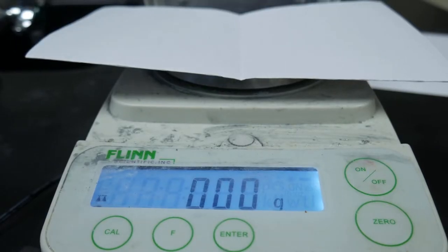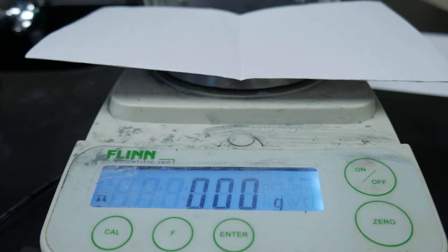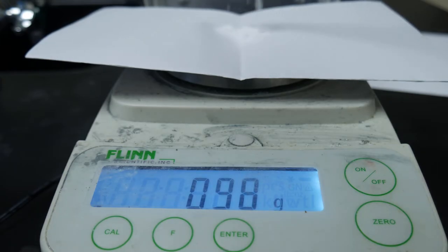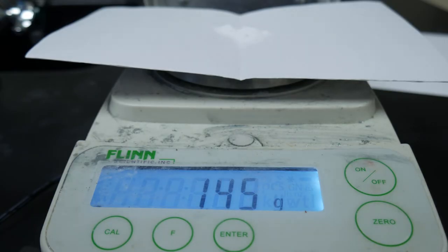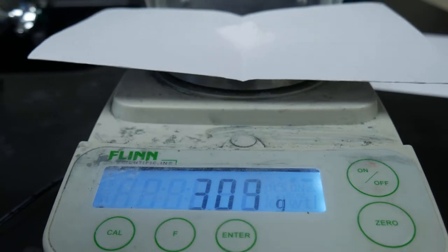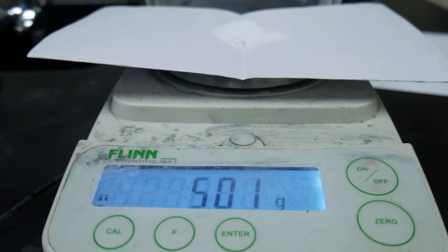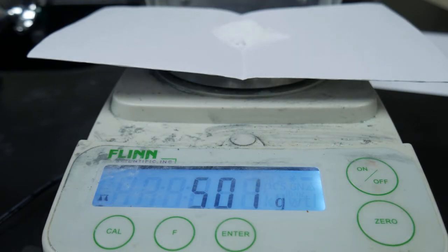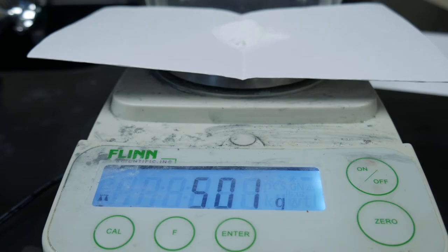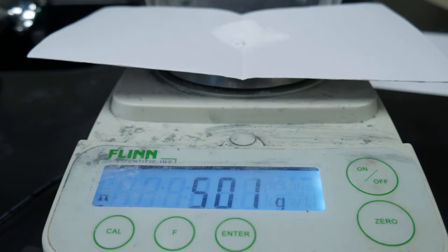Now we're going to add another 5 grams of baking soda onto our scale. We're going to get about as close to 5 grams as we can, but it might not be exact, so we'll have to record the exact number. It looks like we have 5.01 grams, so for trial two in your data table, record that as the mass of the baking soda — 5.01 grams.